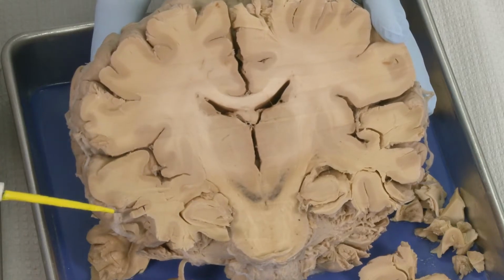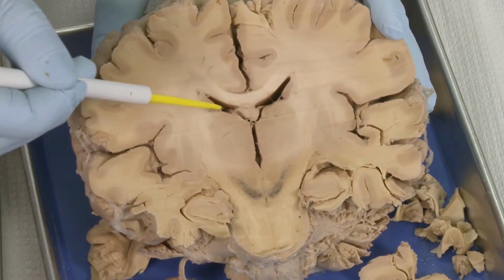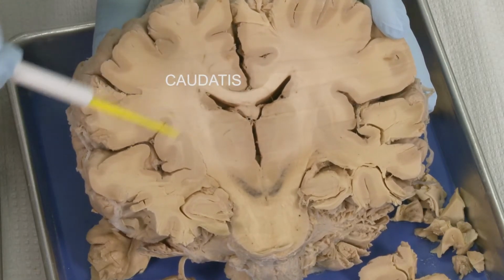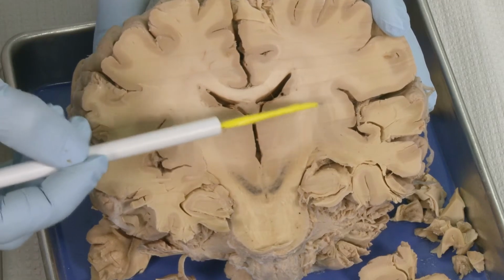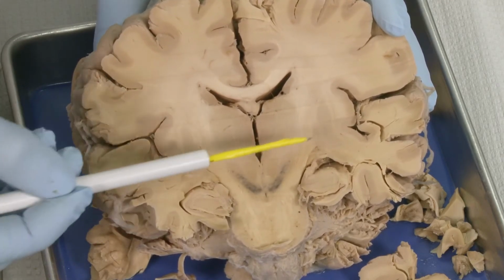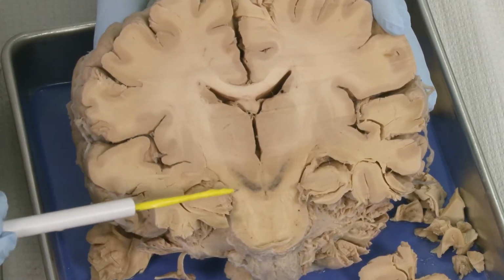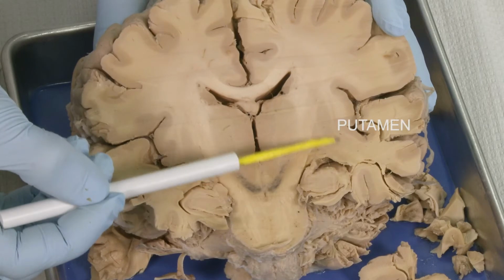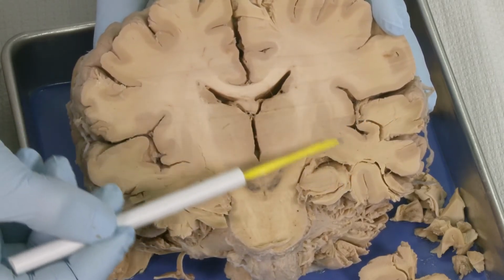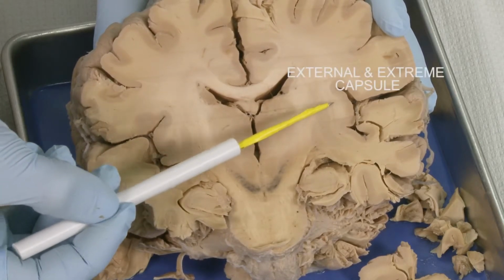So where are the basal ganglia here? One of the members of the basal ganglia is the caudatus. It is here. It is very small here, but then we have other structures which are more pushed to the side and lateral. So this is caudate and this is putamen. I'm sorry, this is putamen and the globus pallidus, which are bordered by the external and extreme capsule.